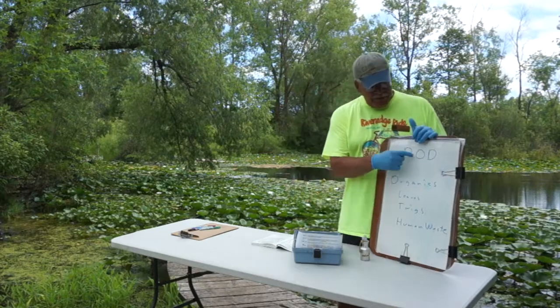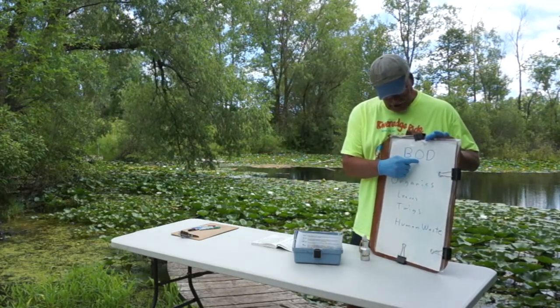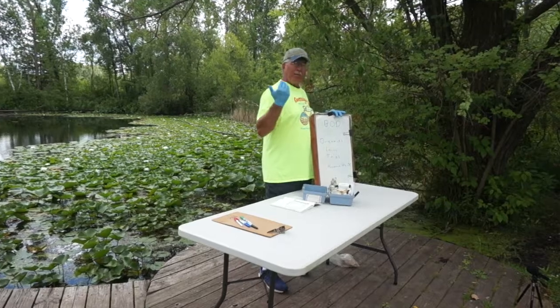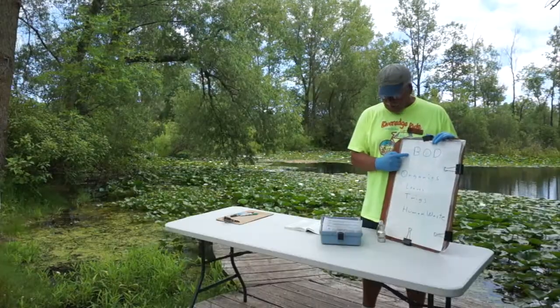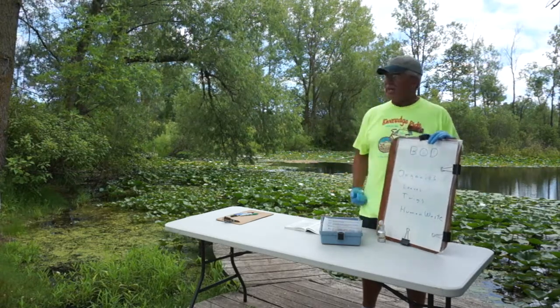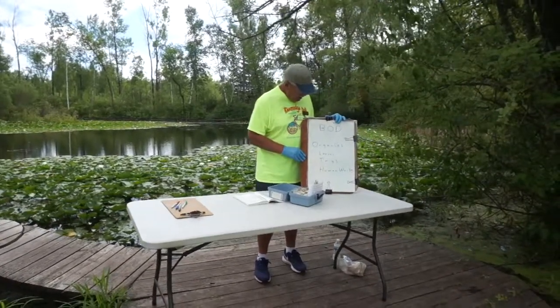First of all, BOD is just an acronym. It stands for Biochemical Oxygen Demand. And so what we know for certain is that bacteria, many of them are aerobic, meaning they like oxygen. And so if you put them in a container with something they can eat, food, they'll gobble up your oxygen. And that's what we're going to take advantage of, those greedy little bacteria.